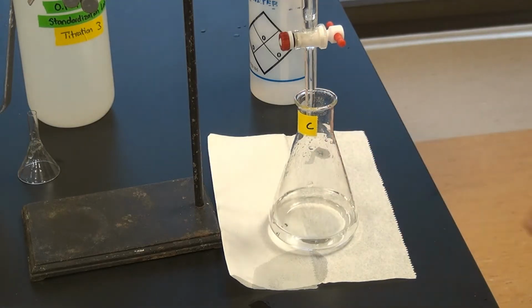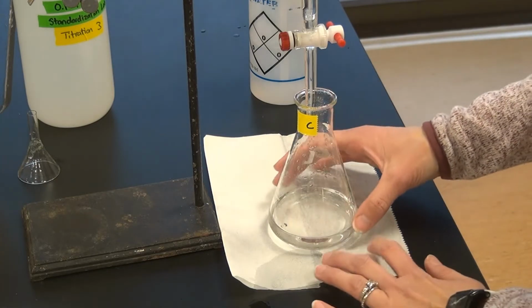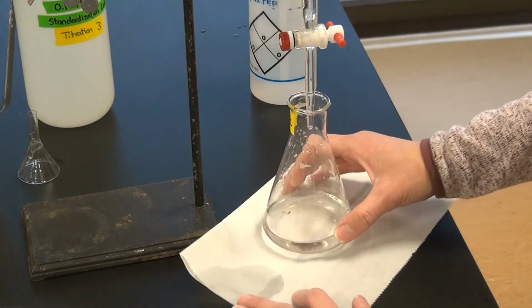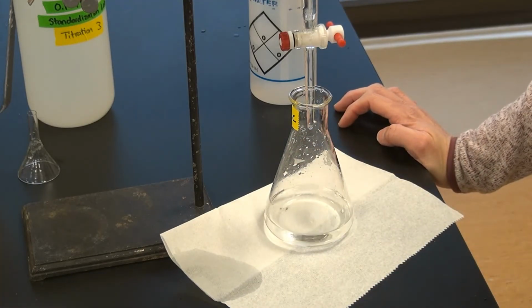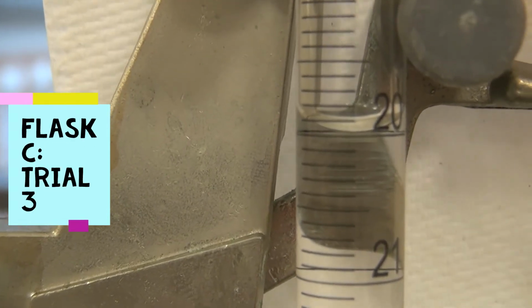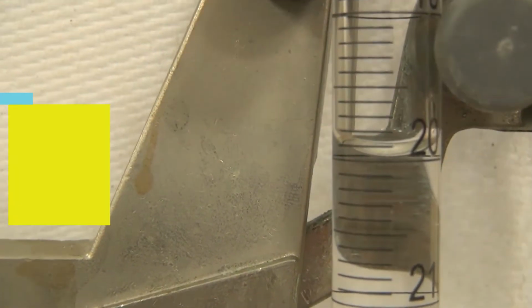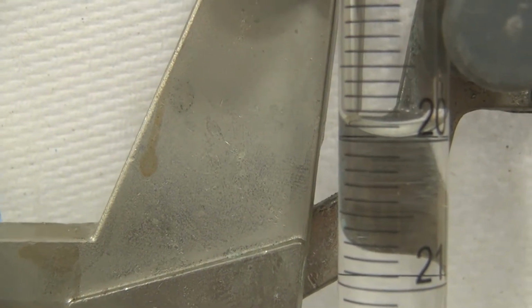almost exactly 20 mils. So we're going to go ahead and do the drop by drop right now because we're pretty close to the same volume as the previous flask, and the KHP mass was very, very close. So I think we'll go ahead and stop here, be safe, just drop by drop. Okay, so we're still on flask C here, and we're doing drop by drop, so we're going to go ahead and record the volume here. It looks like it's right at the meniscus at 20, so 20.00.